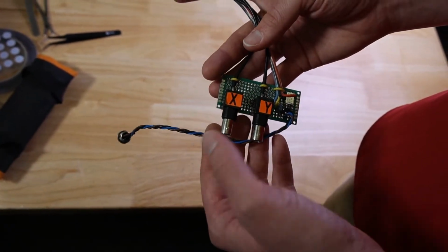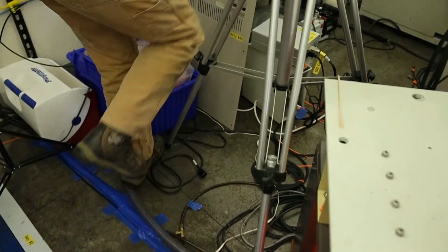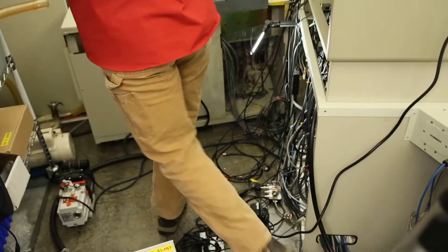We're not going to quite be using this particular board though, since we also want to be running our X-ray analysis, and the X-ray analysis also sometimes uses the scan port. So instead, we're going to be using a different JEOL external scan breakout that lets us also plug the X-ray in simultaneously.